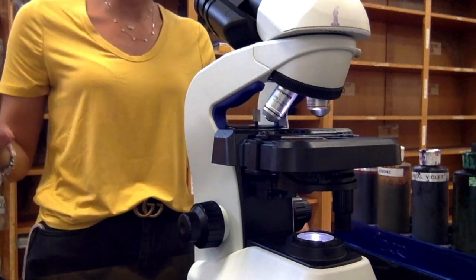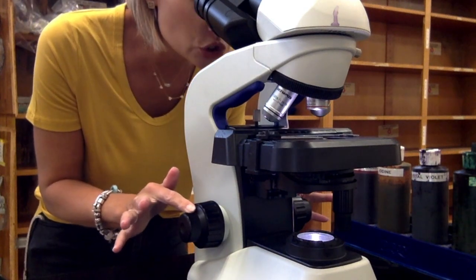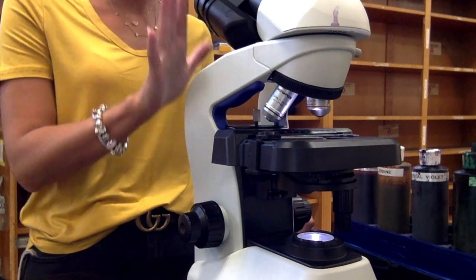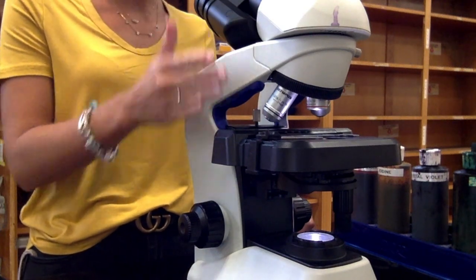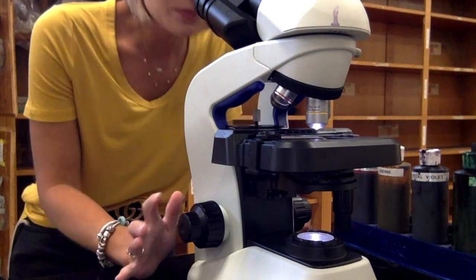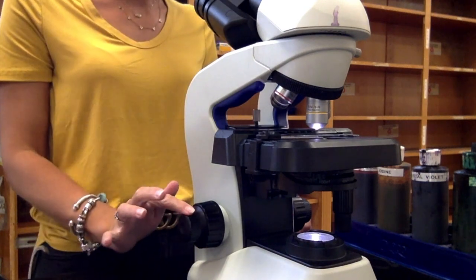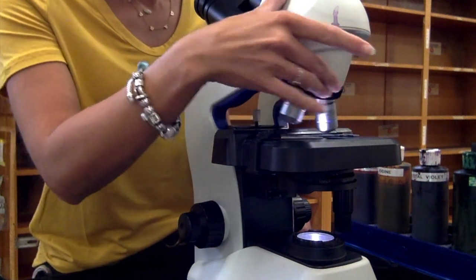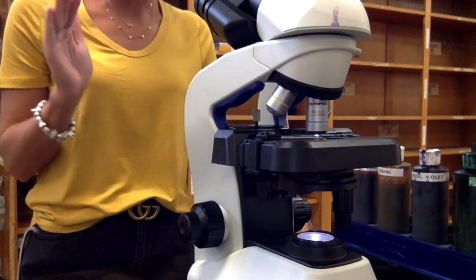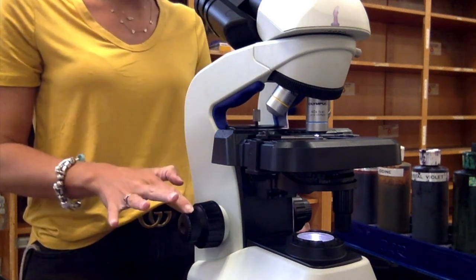Since we're doing colored stains, lift the stage using the coarse adjustment until you start to see color, then use the fine to get it into sharp focus. These microscopes are par focal, meaning once you've got it focused at 4x, you should not have to touch the coarse again. Move on to the 10x objective lens — it will be a little out of focus, so touch the fine just a little bit. Then move on to the 40x. You'll notice the lenses are starting to get really close to the slide — that's how it's supposed to be. Touch the fine again to get as close as you can.